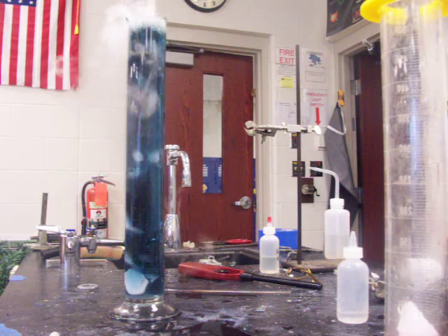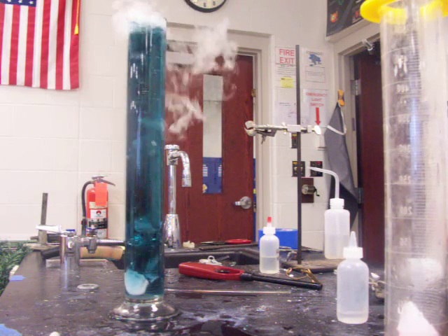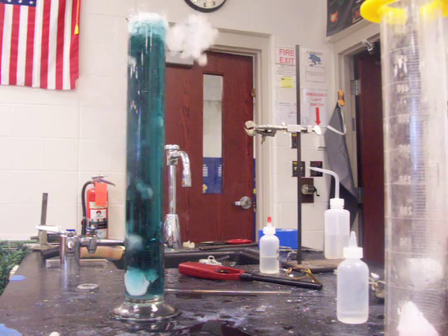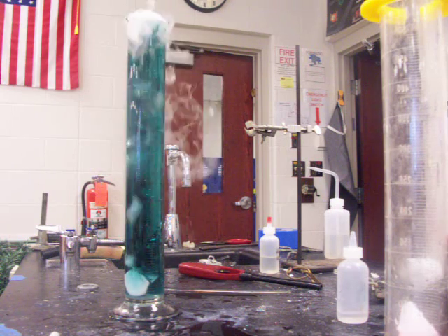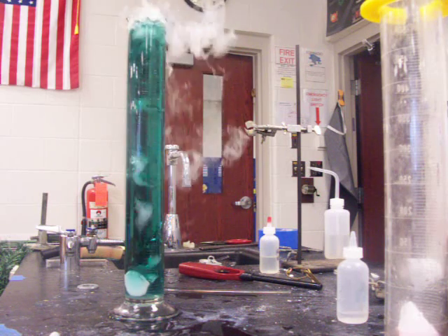After the blue we should see the green color of the neutral, and then we'll see the yellow of the acid. And we won't get all the way into the orange or red of the acid without adding another acid back in.